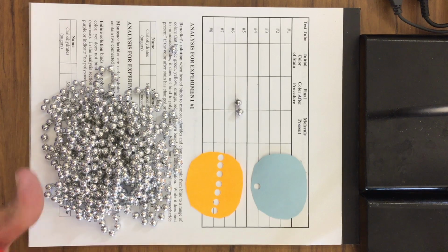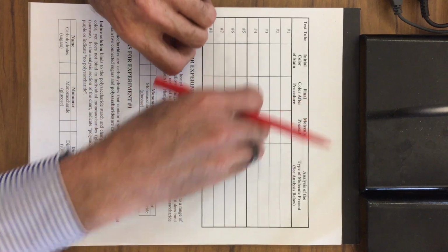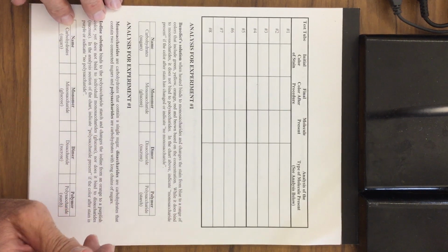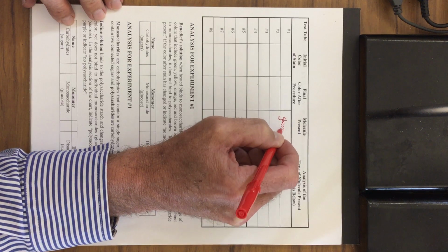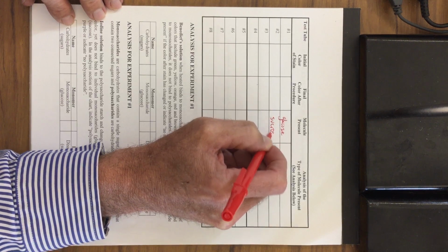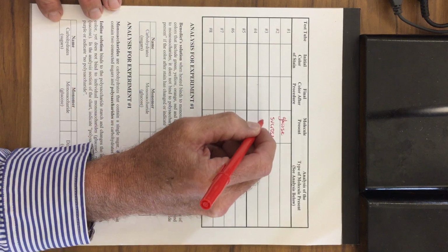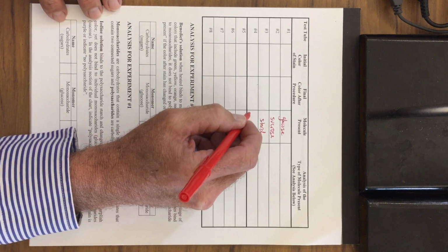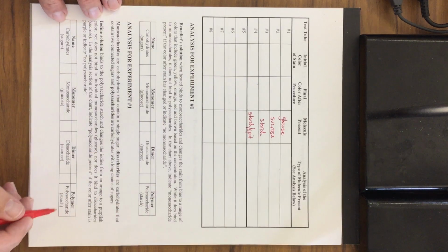So we're going to go through the lab, indicate everything that we had from the beginning, and then see all the color changes that we had as well. We're going to list the molecules present if you haven't already done this. In test tube number 1, we had glucose. Glucose is a monosaccharide. Test number 2 has sucrose, which is table sugar. That's a disaccharide. And number 3 has starch, and starch is a polysaccharide.